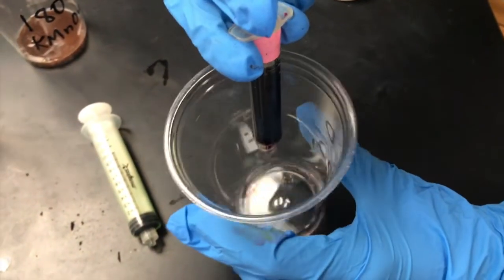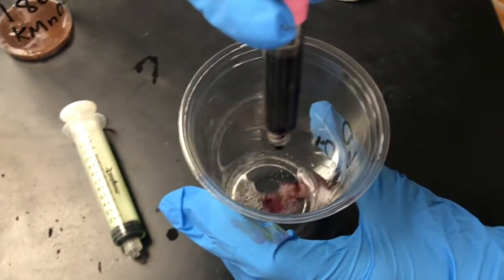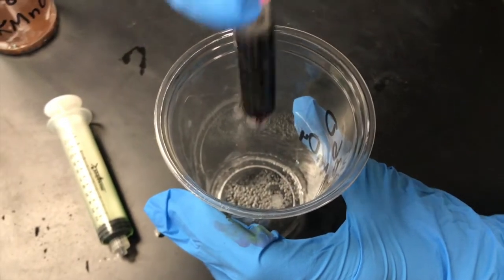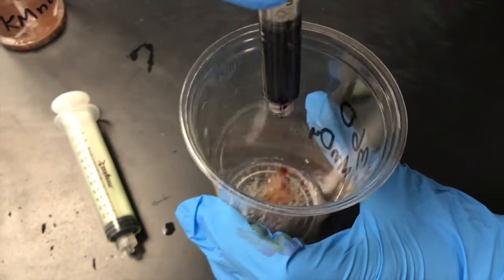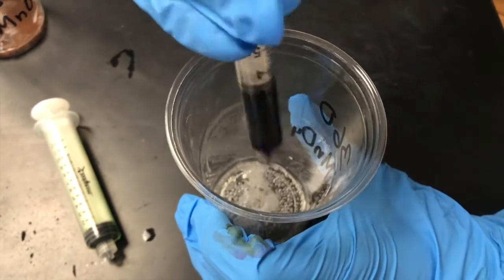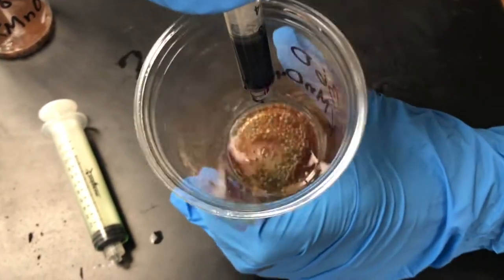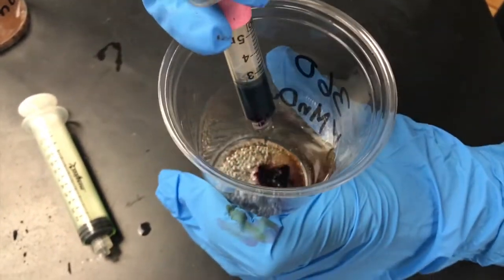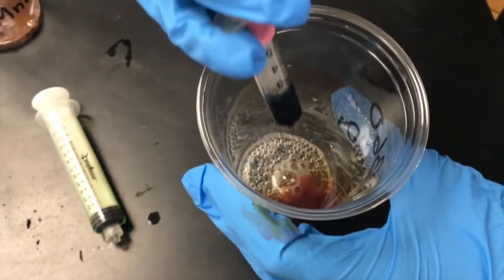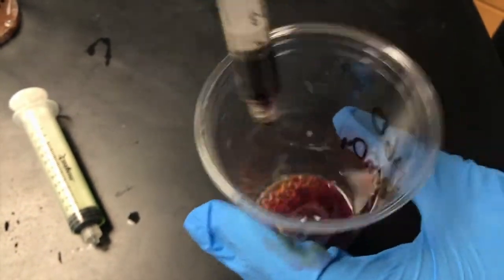With a baseline of 3.5 milliliters of potassium permanganate established earlier in the lab, we were able to see how our new solutions compared in hydrogen peroxide concentration. The most KMnO4 was needed at the 10-second interval because of the higher levels of hydrogen peroxide still remaining. By 360 seconds, the most H2O2 substrate had been broken down into water and oxygen, requiring little titration. These findings led us to conclude that as more time passed, H2O2 was consumed at a lower rate. However, more was consumed in total.